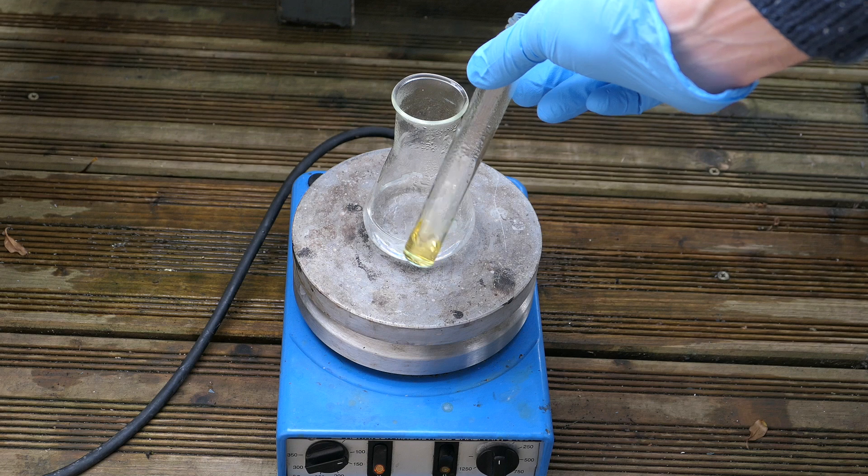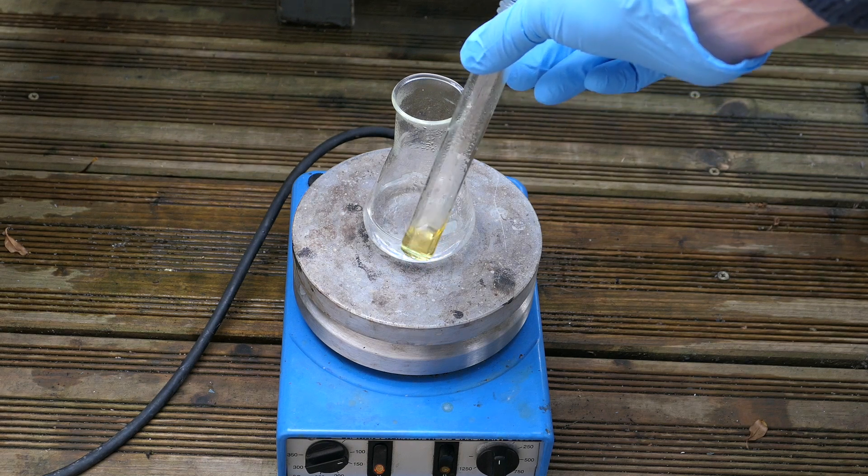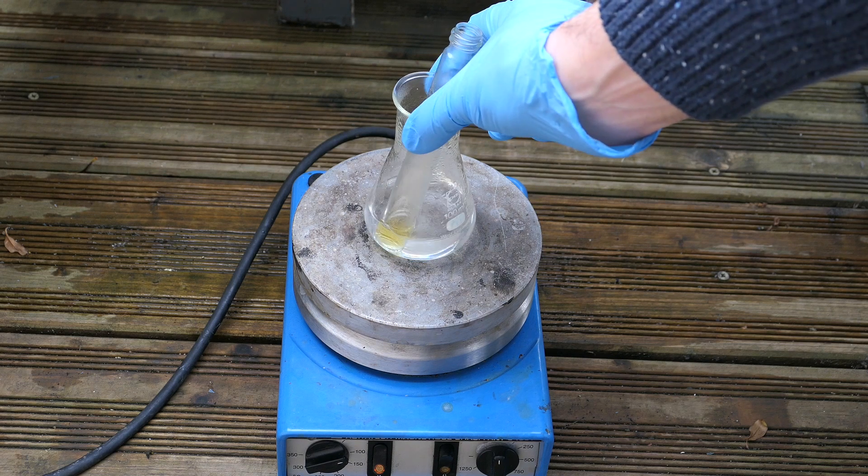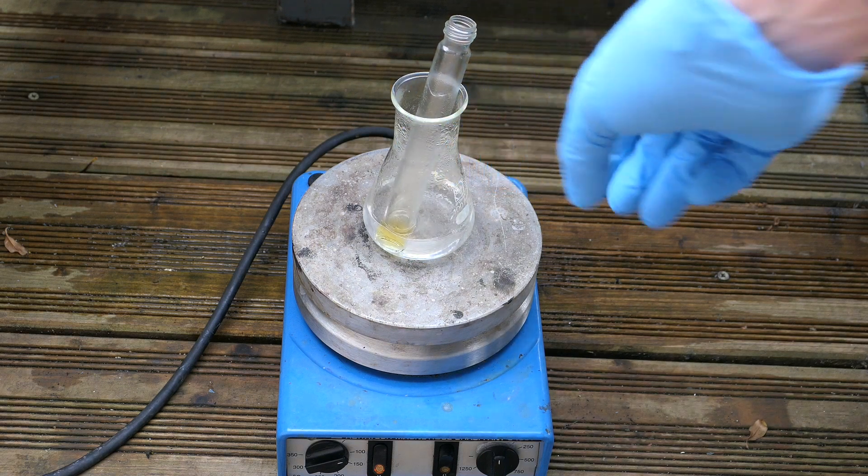Instead I'm going to take a safer approach and use electrolysis in hydrochloric acid. By doing this I can dissolve the platinum and create the hexachloroplatinic acid.